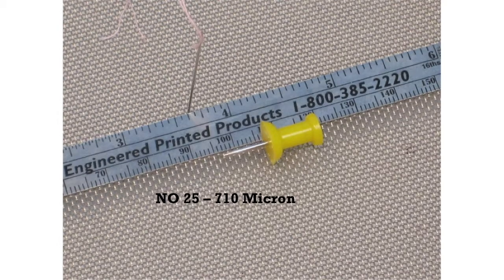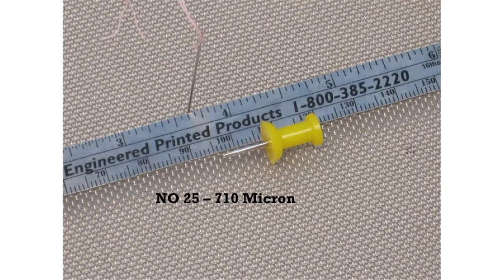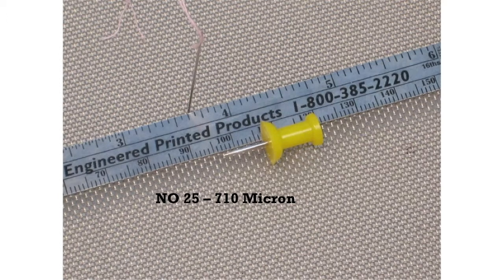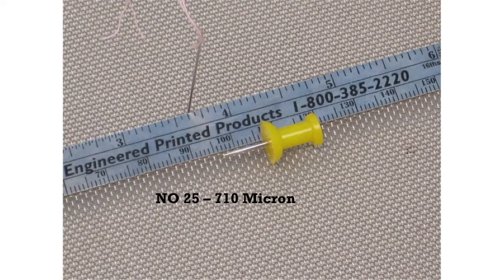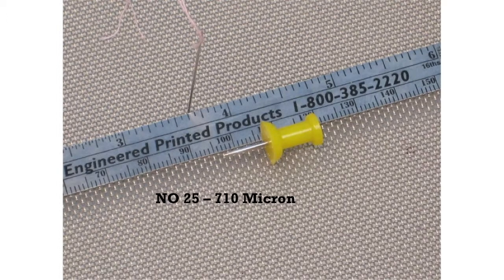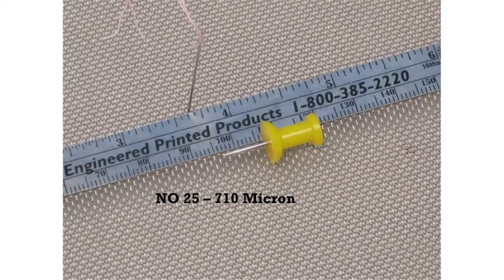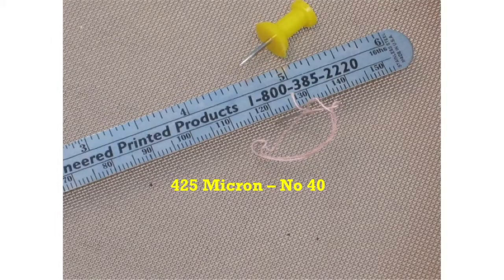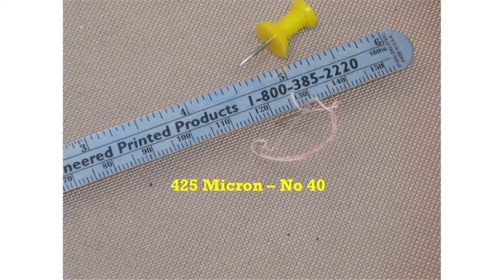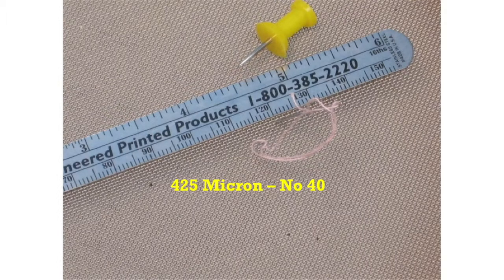As the sizes get smaller — for example, a 710 micron or number 25 sieve — a small sewing needle will pass through an opening, but a push tack will not. At the level of a 425 micron sieve, or a number 40, only the point of the needle will fit into the holes in the mesh.